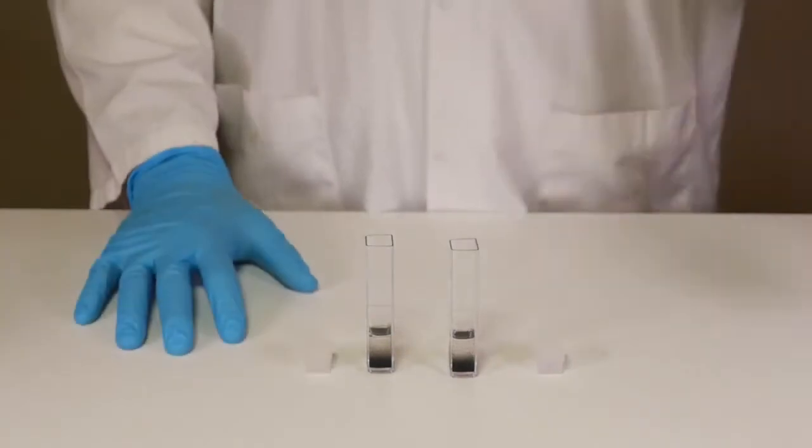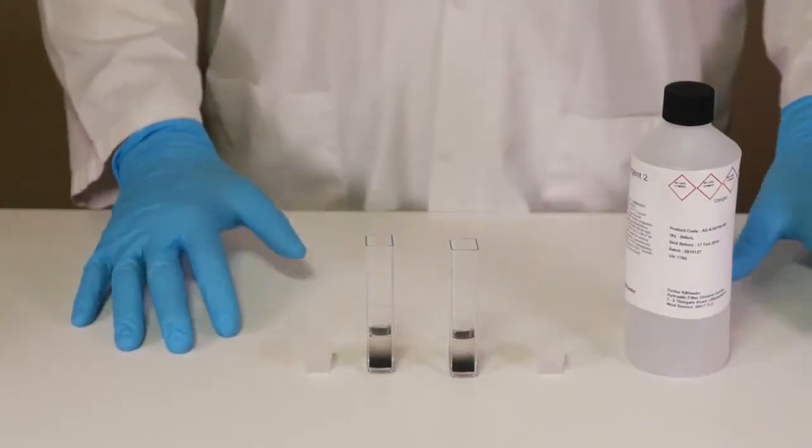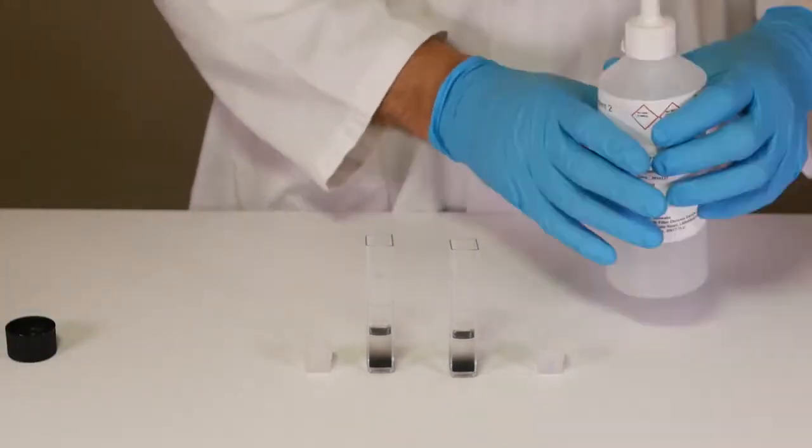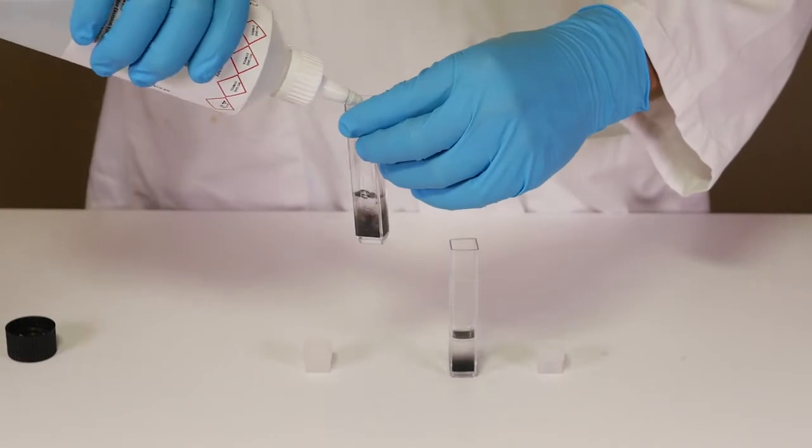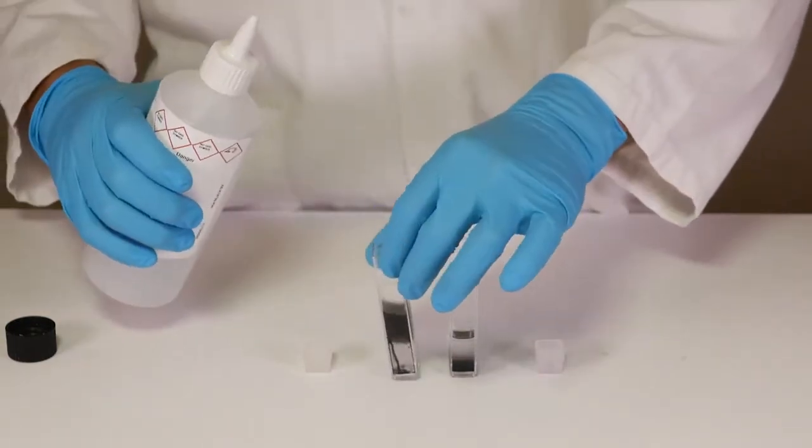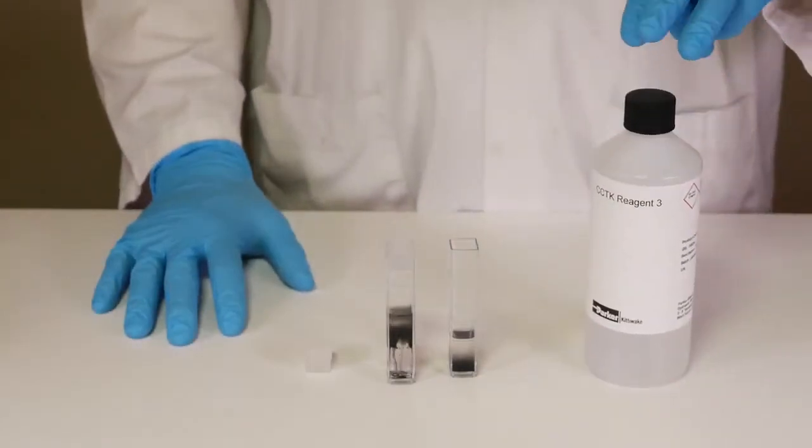Fill one of your cuvettes to the 10 milliliter graduation line with reagent two and the other with reagent three.